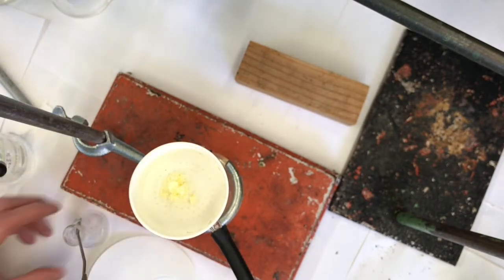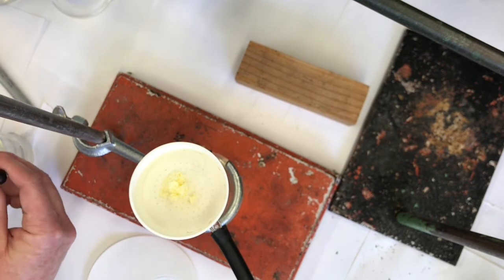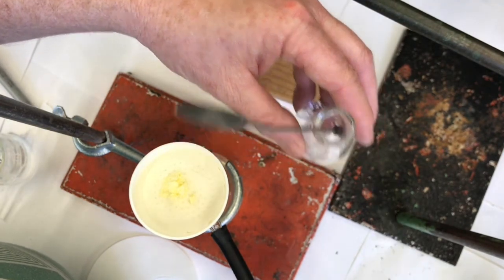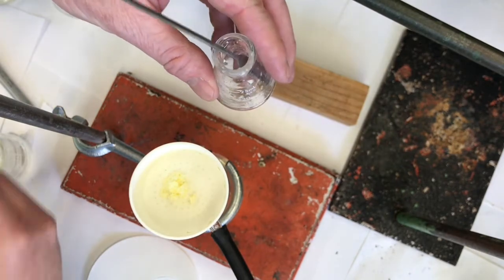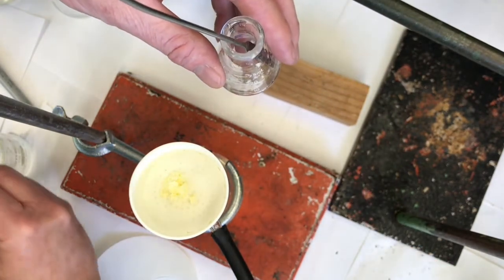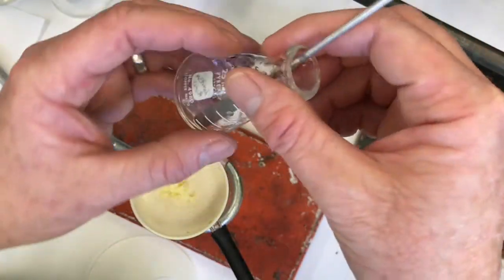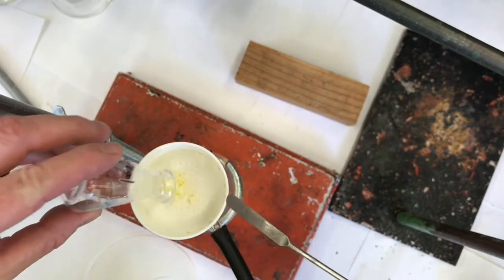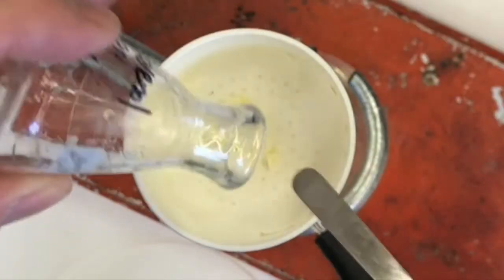it's going to be white. So let's try it. So I'm going to take some of my 80-20 methanol, put that in my flask. I'll put a couple squirts in there and I'll observe and see if it looks like it's dissolving the solid very quickly, then I'll be careful with it. I won't add too much. No, it looks pretty good. Can you see through there? Yeah. So I'll swirl that around, dump it on my crystals.